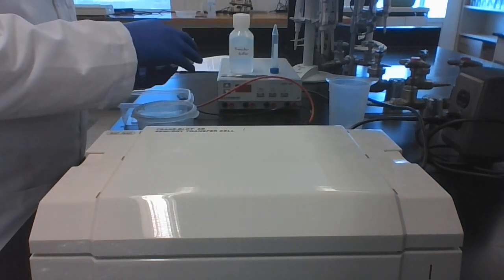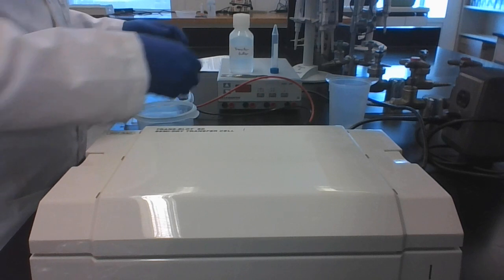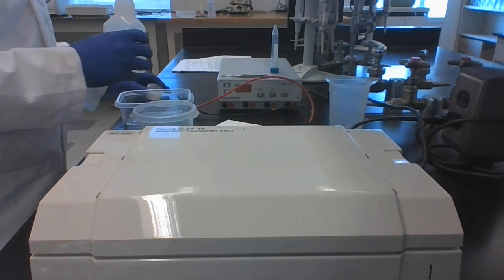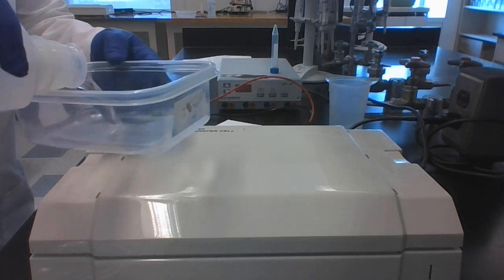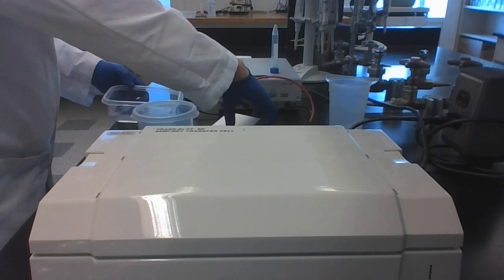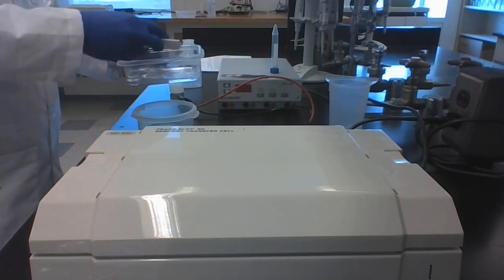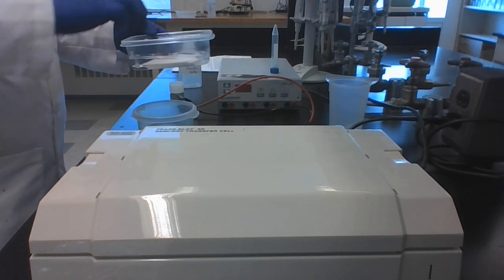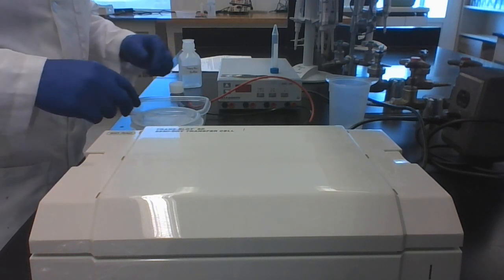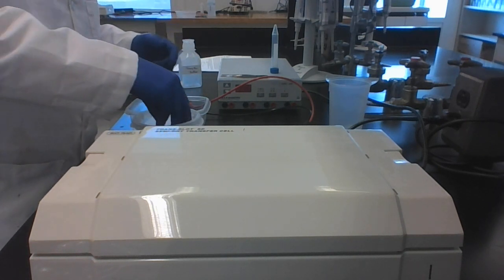So the first thing we have to do is we have to get everything into transfer buffer that we're going to use. We can place this whole stack right into the transfer buffer, make sure it gets soaked. So we are equilibrating it, which simply means to soak it in whatever you want to use, in this case transfer buffer.